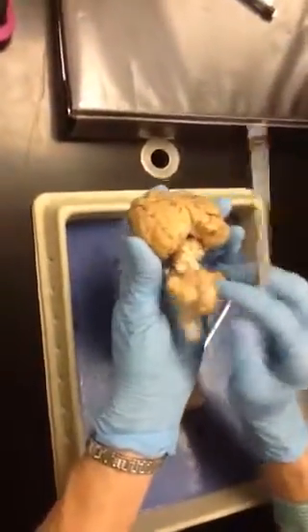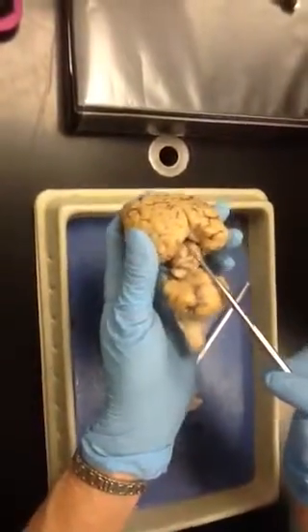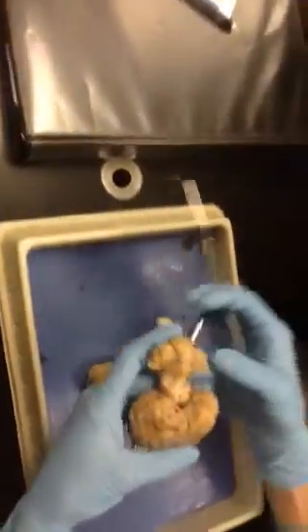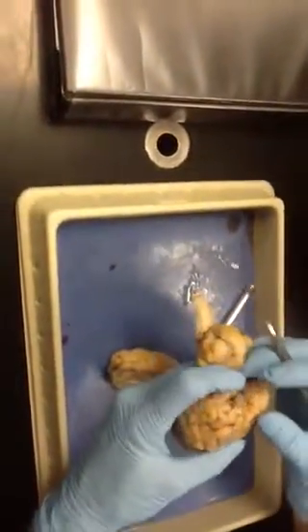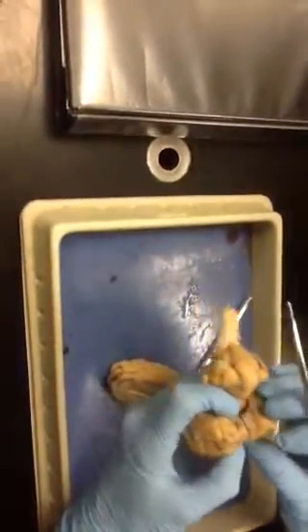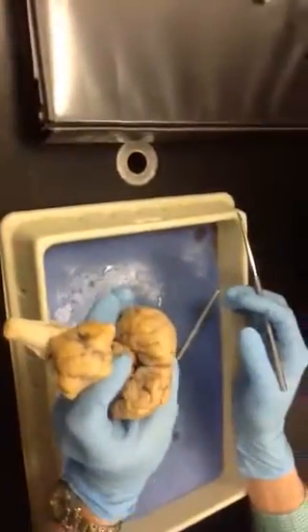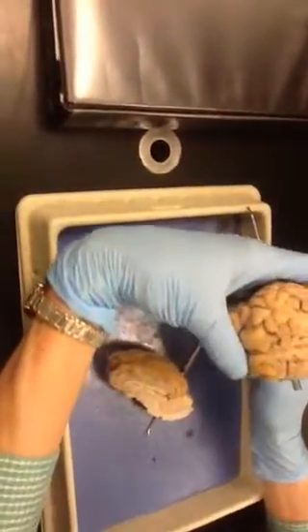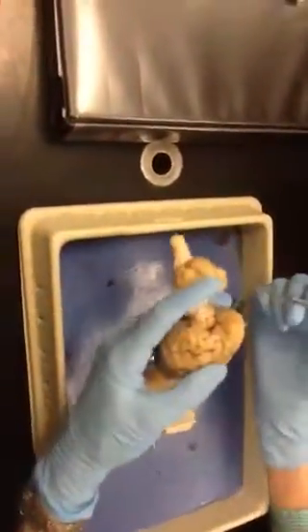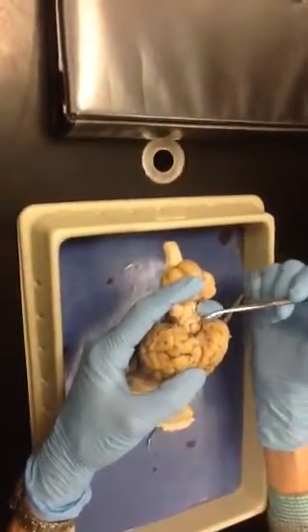Yep, if I pull this down, your pineal gland is way back in here. If I pull this down a little bit, you see the butt cheek back there? If you look real close, I have to pull it down maybe a little more, open it up a little. There's a little bump that sits right on top of the butt. Can you see it back in there deep? That's the pineal gland that's sitting on top of the butt. Okay? The big butt cheeks right here are the superior colliculi. The little ones underneath are the inferior colliculi.